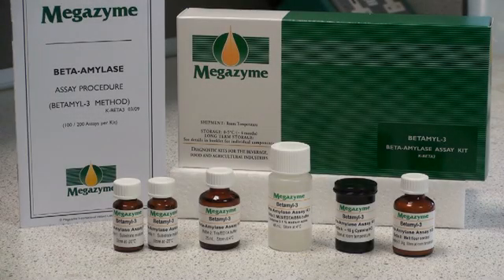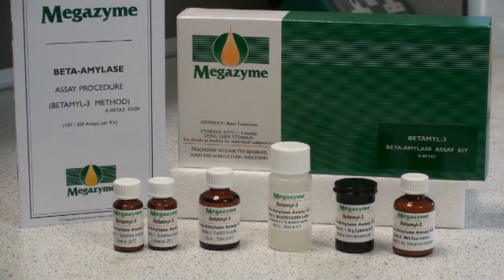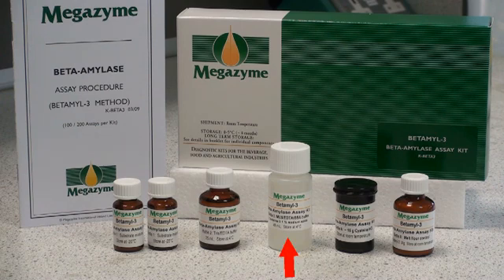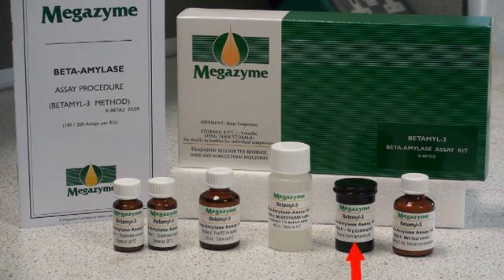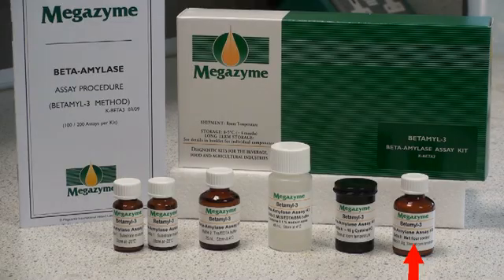The beta-amyl-3 kit as received should contain an instructions booklet, two vials of substrate containing p-nitrophenyl-beta-maltotrioside plus beta-glucosidase, a vial of Tris-HCl buffer, a vial of MES buffer, a container of cysteine hydrochloride, and a container with malt flour control standardized to a particular beta-amylase activity.